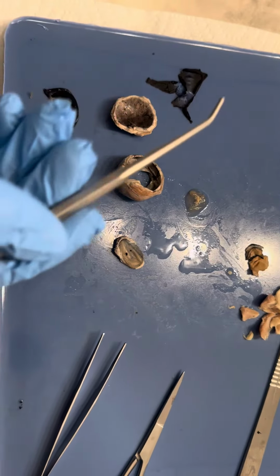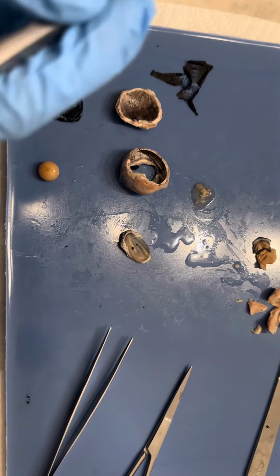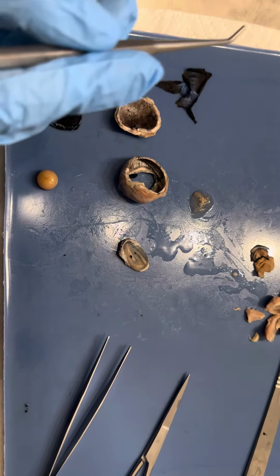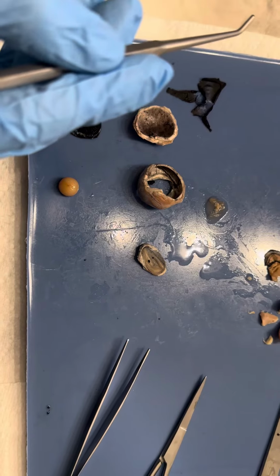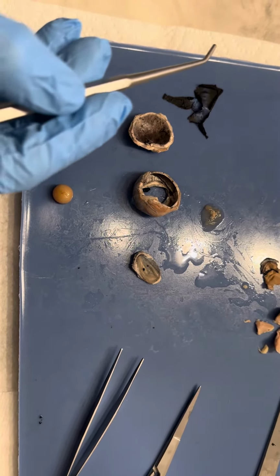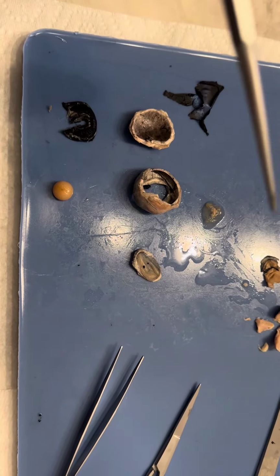As we were dissecting the eye, numerous fluids came out. The first fluid that I'll talk about is the aqueous humor. So this is a clear fluid that fills the area between the lens and the cornea, so the anterior portion of the eye, and this helps maintain the shape of it. Another fluid that helps with this is the vitreous humor, which is found in the vitreous body. This is the cavity between the retina and the back of the lens, so the posterior portion of the eye.